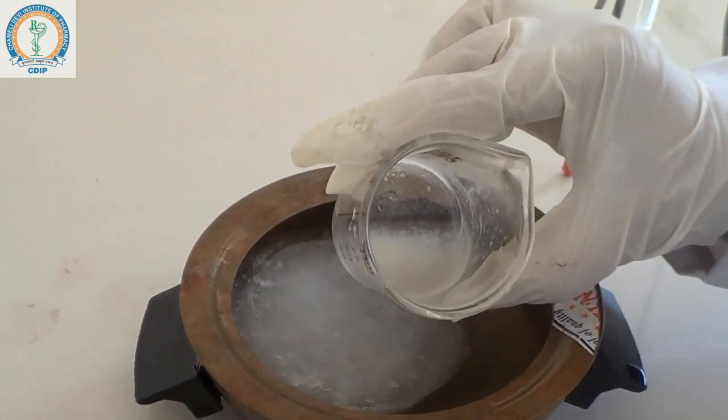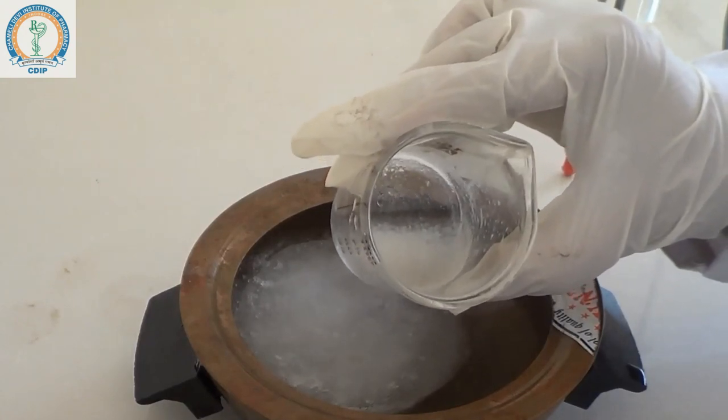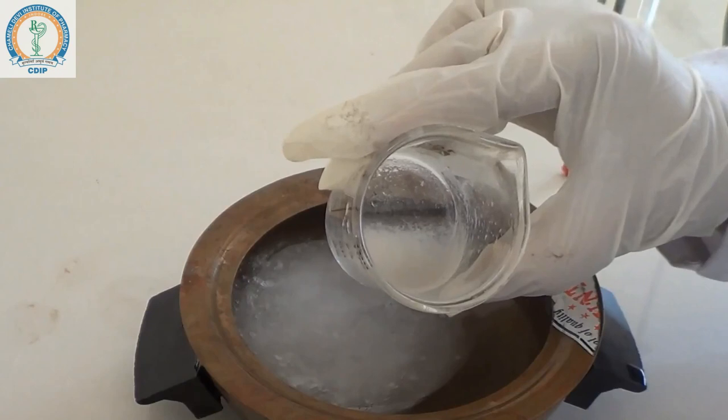As you can see, the crystals are formed. This is the pure form of benzocaine.